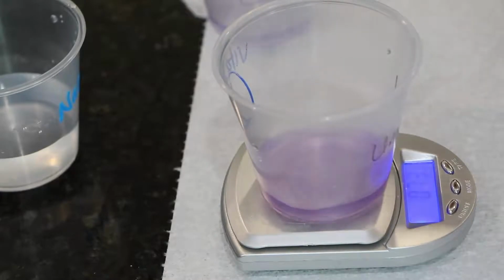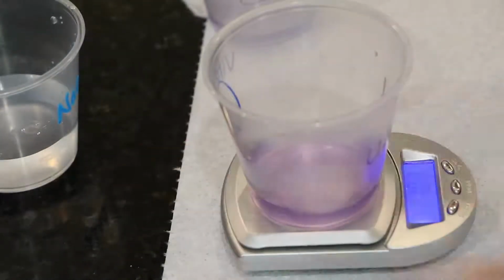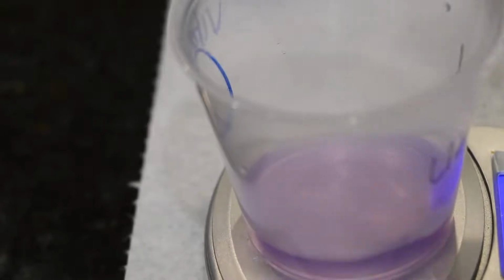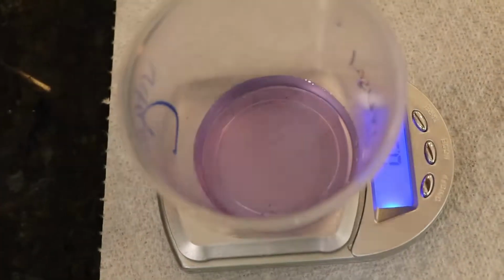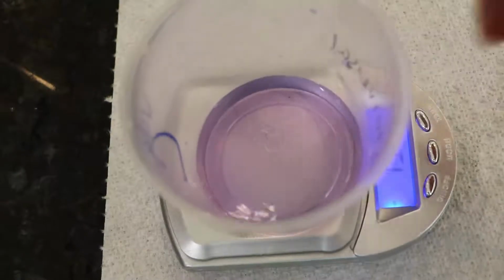If you're using the Cabbage Indicator, you're not going to have a titrated mass 1. But now I'm going to keep going. I'm going to keep adding sodium hydroxide until I see some slight turbidity. Slight turbidity means you start seeing something in that liquid that's not quite transparent. And the camera didn't pick it up very well. But what you're looking for, you can tell there's something else there. It almost looks thicker. That's what you're looking for, this slight turbidity.